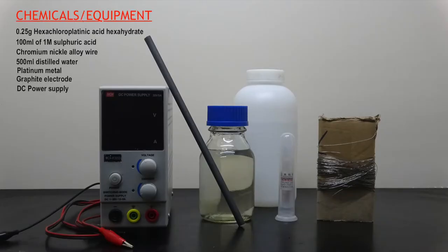In terms of the chemicals and equipment, this is what I have used. Both the sulfuric acid and graphite electrode were prepared or obtained in my previous videos, and the hexachloroplatinic acid was purchased online.